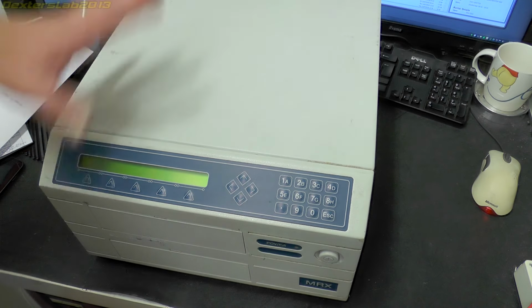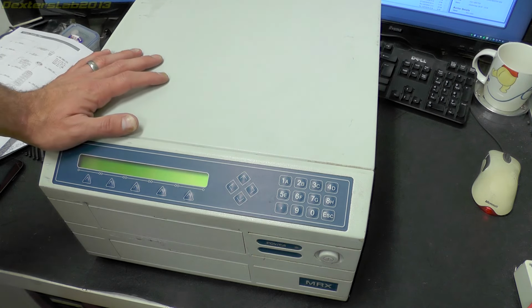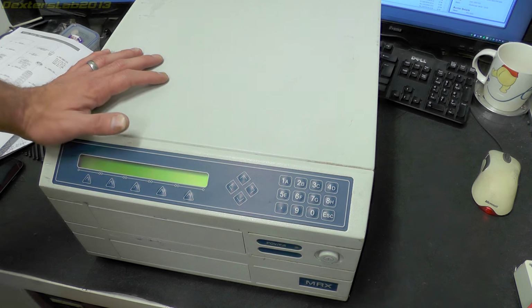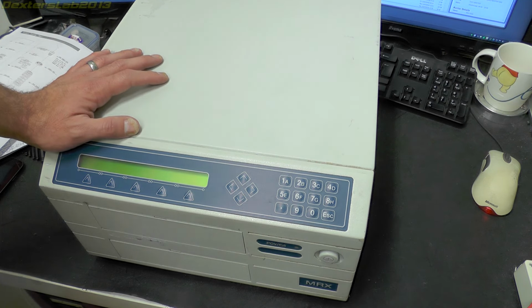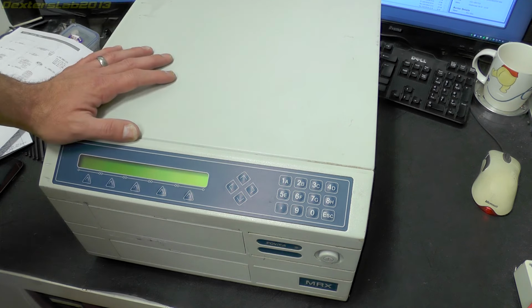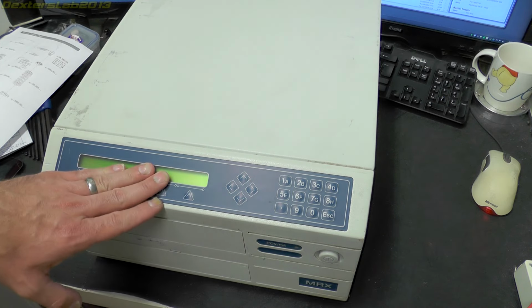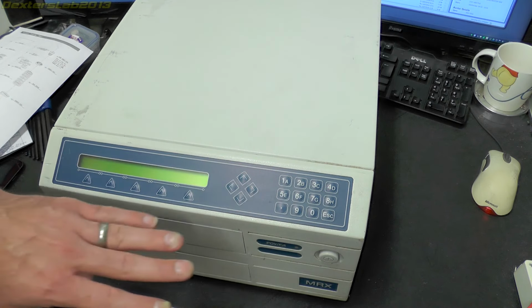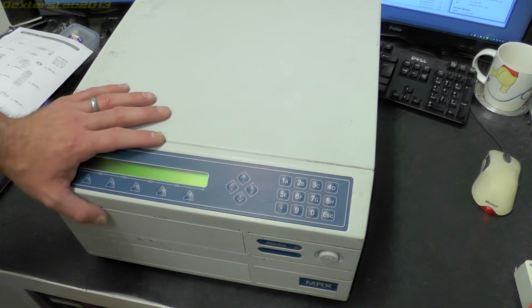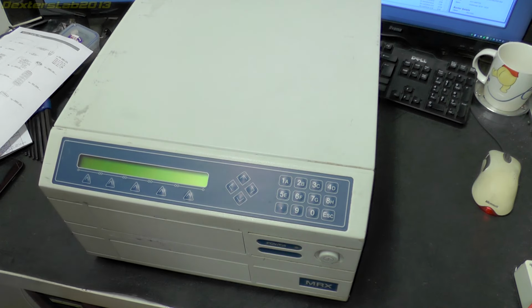Right, so what are we expecting to find inside now? Well, there's going to be a light source, there's going to be some optical things going on to direct the light source into the microplate itself. There is going to be photo detectors of some description, whether they are photodiodes or photomultipliers, I have no idea. There is also going to be some mechanics to make the drawer come in and out. It'll be interesting to see how this front panel here with the LCD screen and here the buttons interact with the actual PC that's inside, how the communication between the two things work, and how the science element is actually linked into the PC. That'll be interesting to see.